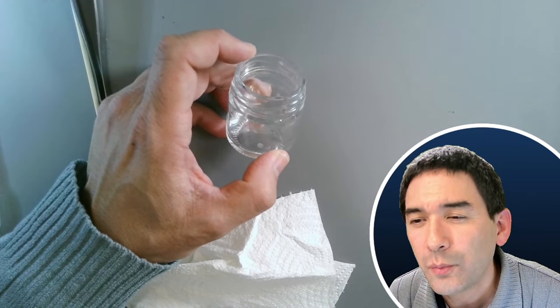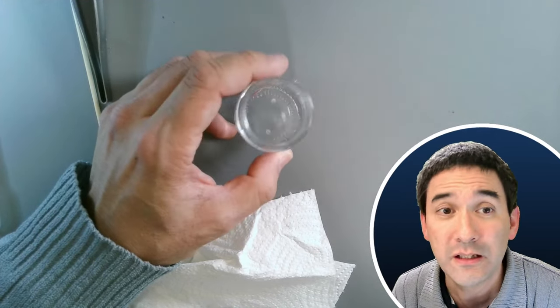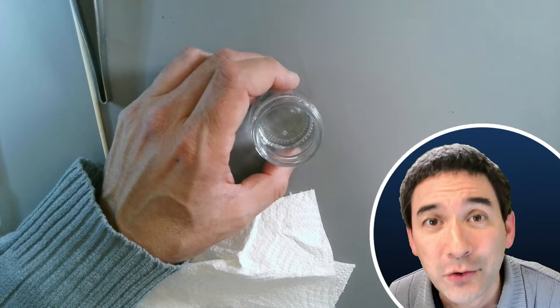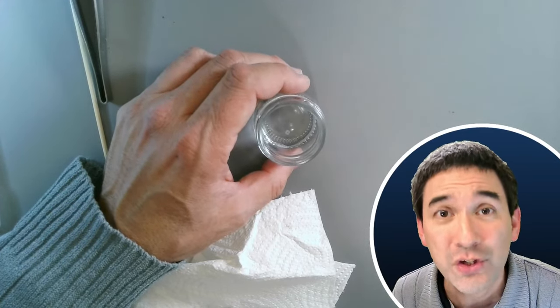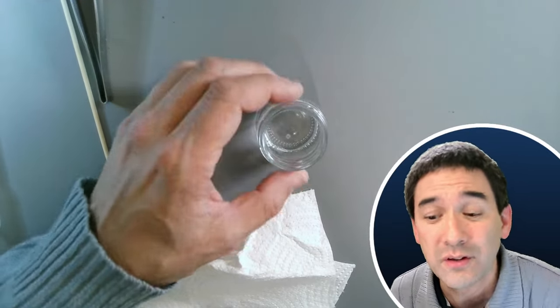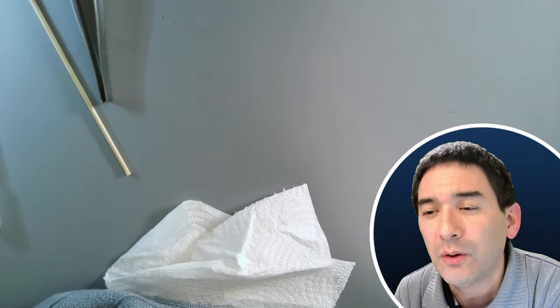I have a microscope worth $125 — is it suitable for my research field? Honestly, it depends what you want to do. There are microscopes costing thousands of dollars still not suitable because they don't have the correct features. It's not really a question of cost but of what you want to do. If you just want to observe nature and the environment, even very low cost microscopes are able to do that.